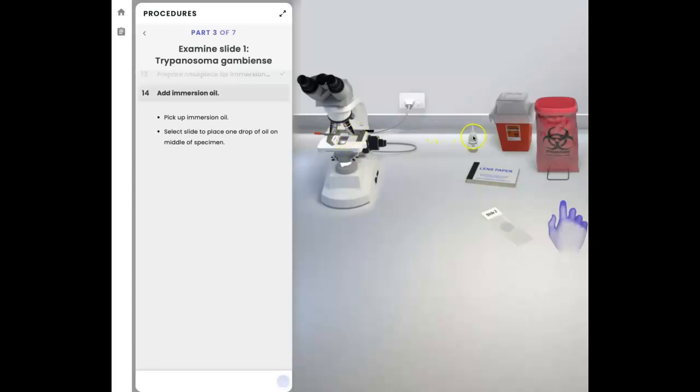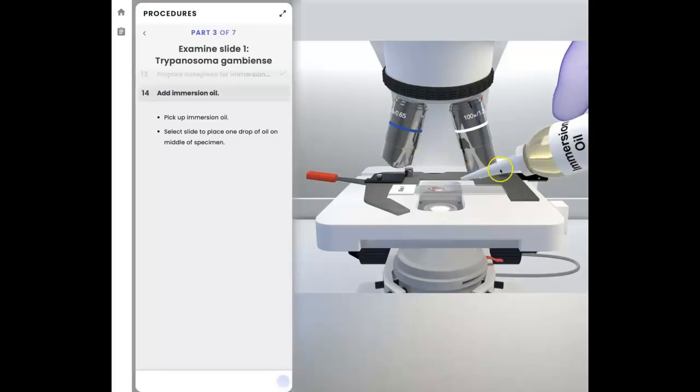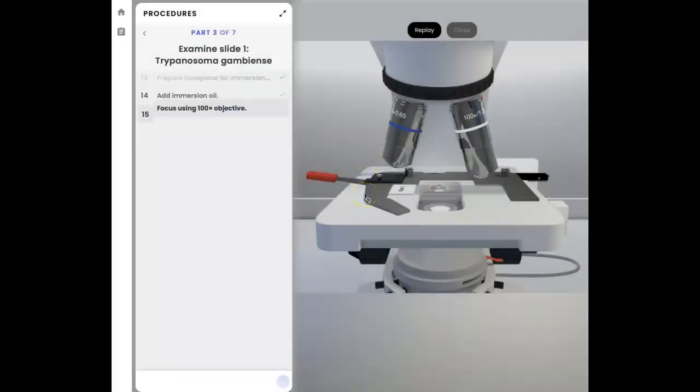So now we're supposed to add this oil to the slide. So we're going to pick up the immersion oil, and I don't know if this works that well. So I'm going to grab it, hover, is that the correct pronunciation? I guess put it on top of the slide, you know what I mean. And I'm going to let go of that, then start adding the oil. I can actually see that there's a droplet of oil there. I'm going to close that, I don't need to replay it. And let's see what happens next.